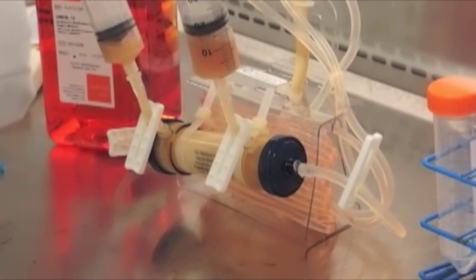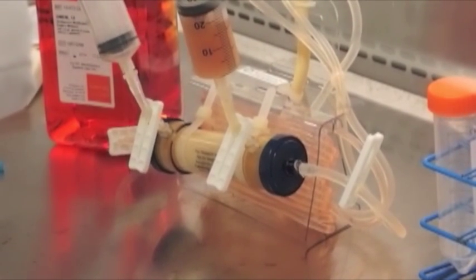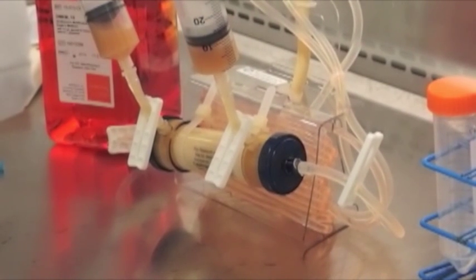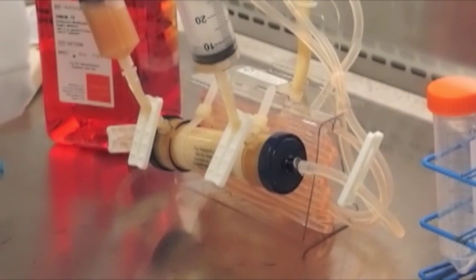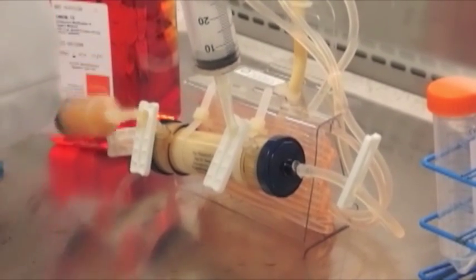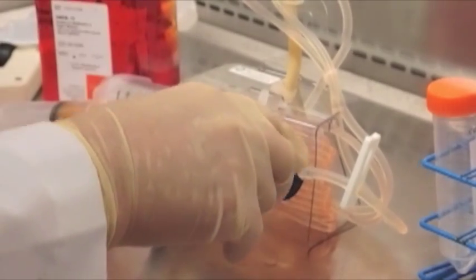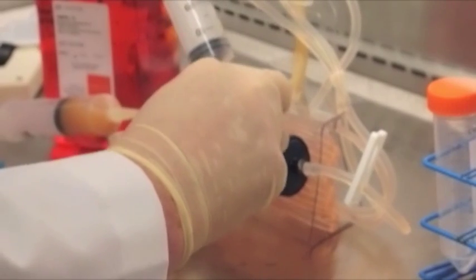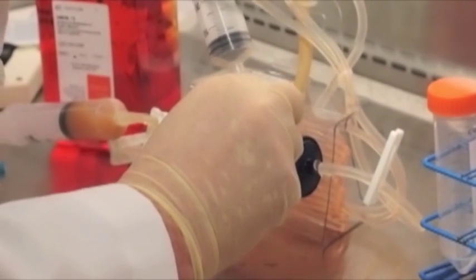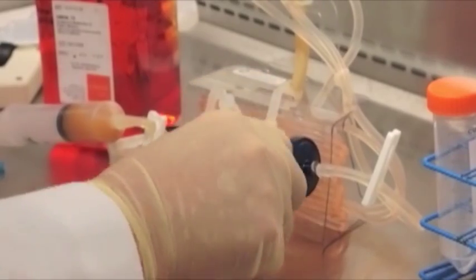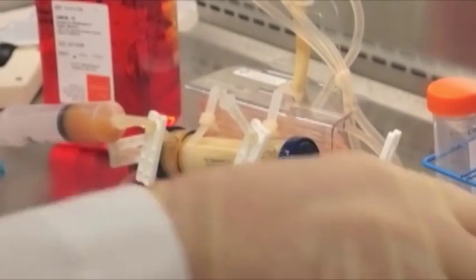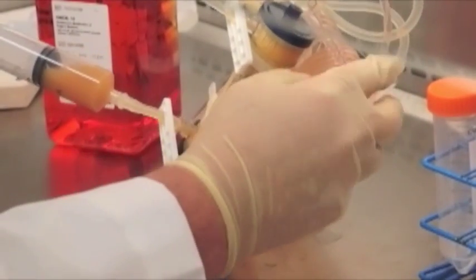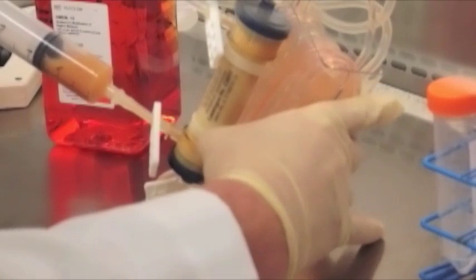Here what we do first is reverse ultrafilter a volume of 20 mils into the syringes, and now we can swish them back and forth in order to help increase the harvest number of cells. Then we carefully withdraw the cell harvest from the cartridge into the syringe and drain the extra capillary space of the cartridge. This allows us to efficiently harvest the majority of cells present.